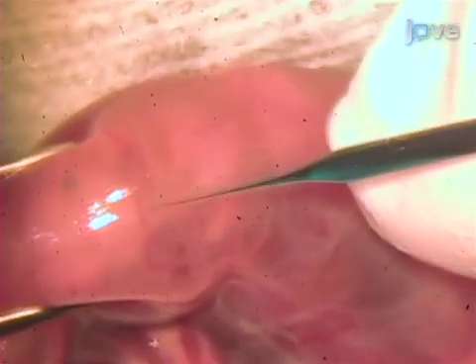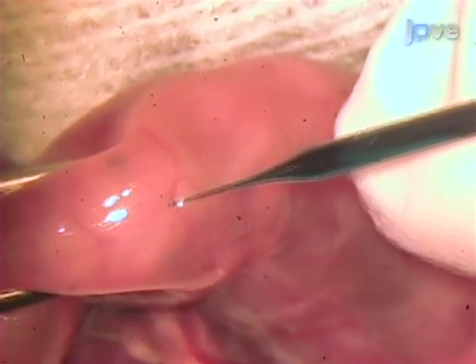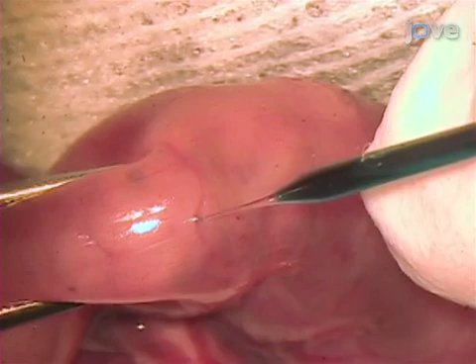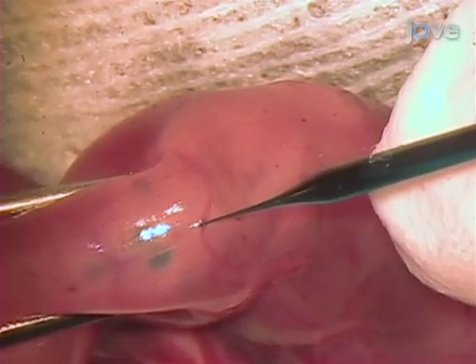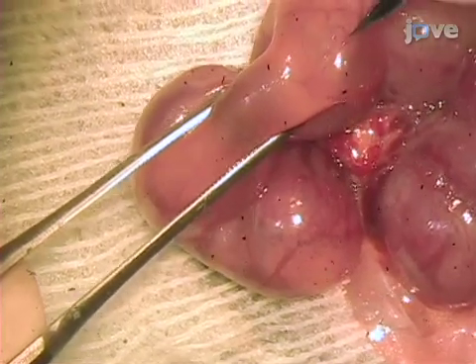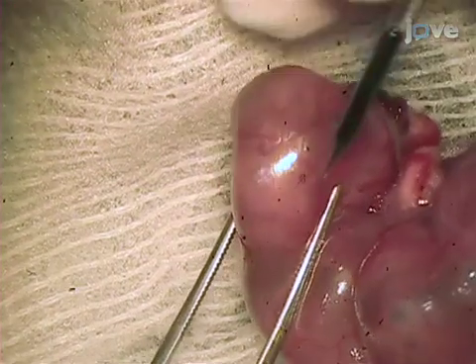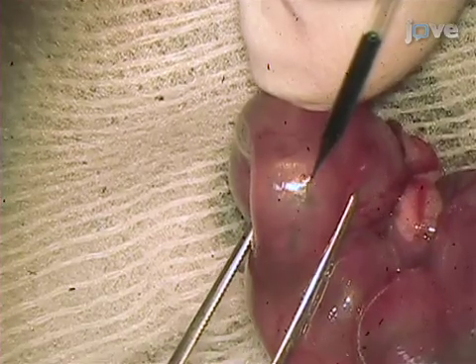Hold the glass micropipette with the DNA prepared earlier at 45 degrees to the uterine wall and puncture it at the rostral end of the interhemispheric fissure, penetrating to about 1 mm depth. In this way, the tip of the glass micropipette will enter the third ventricle of the brain and not the lateral ventricle. Afterward, inject about 1 µL of DNA solution into the third ventricle. Green fluid will fill the ventricle in a good injection. Repeat the same procedure with all the embryos of the same uterine horn, allowing time for the DNA solution to mix evenly with the ventricular fluid and reach the entire neuroepithelium.